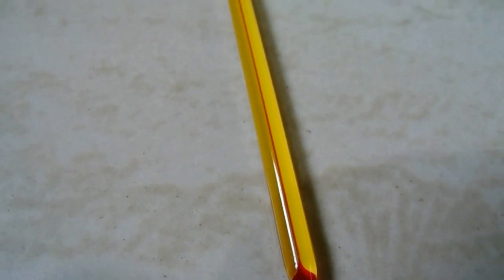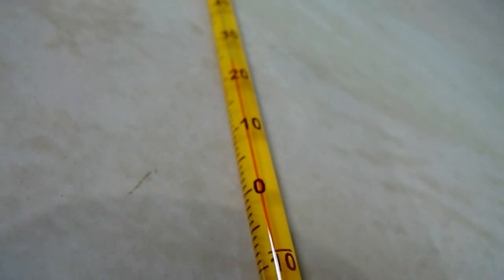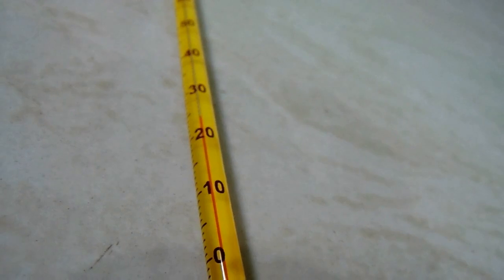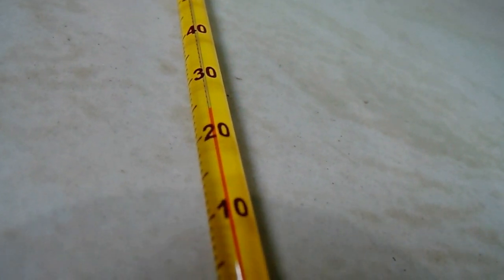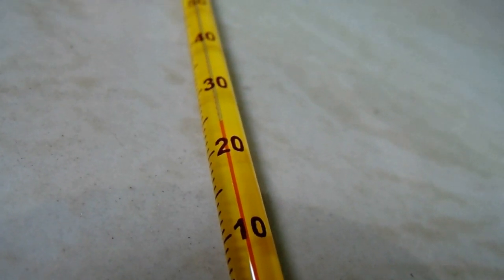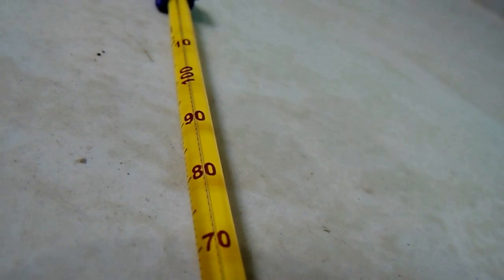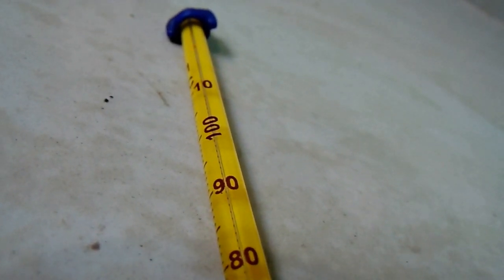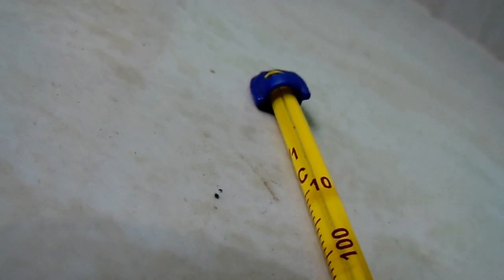This is the conducting tip of the thermometer. Here are the readings, starting from minus 10 degrees centigrade to 0, then 10, 20, 30, and so on up to 110 degrees centigrade with its subdivisions.